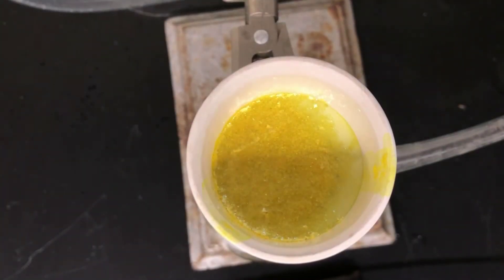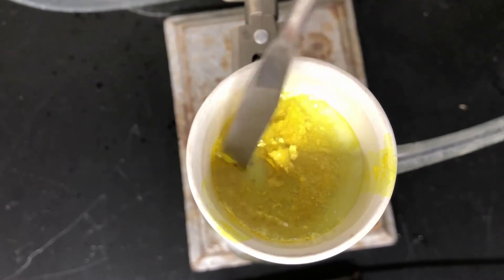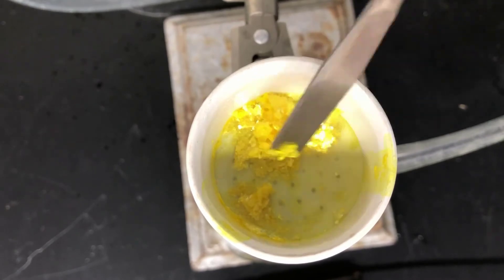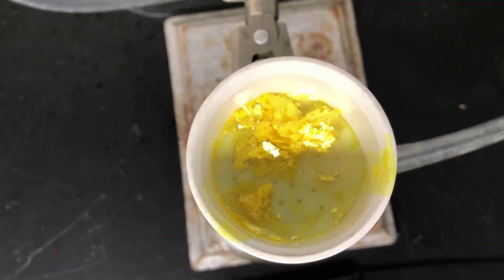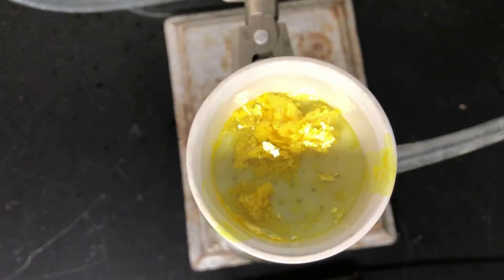The crystals of alkene are still wet with isopropyl alcohol at this point, and they need to be dry before we take their mass or determine their melting point. If we take a melting point on a wet solid, the solvent will function as an impurity and depress the melting point. It's a good idea to let the vacuum pull over your crystals for at least 15 minutes before attempting to take the melting point, or better yet, dry them in your drawer for a week until the next lab period if possible.